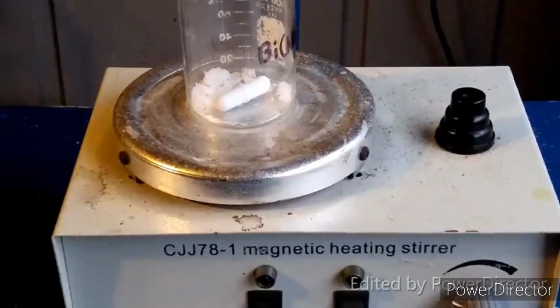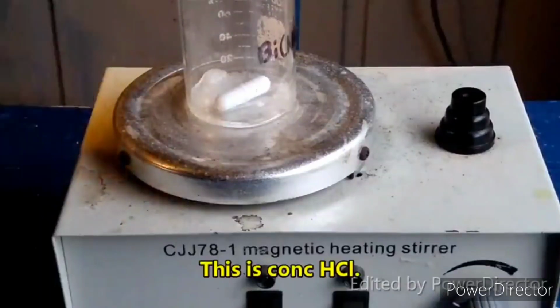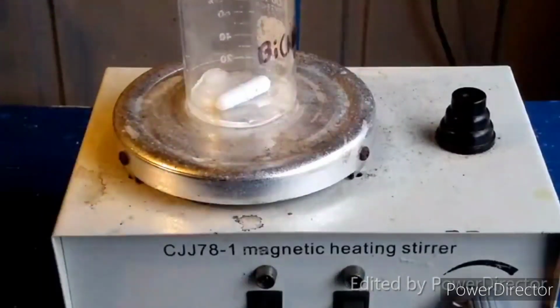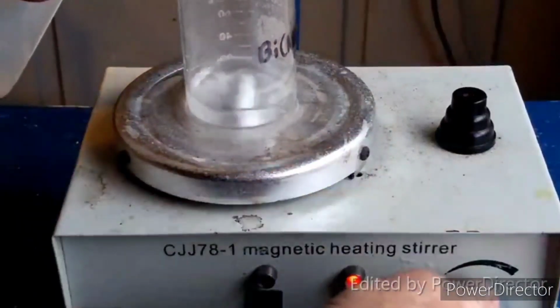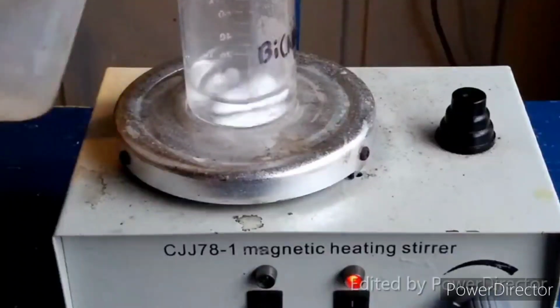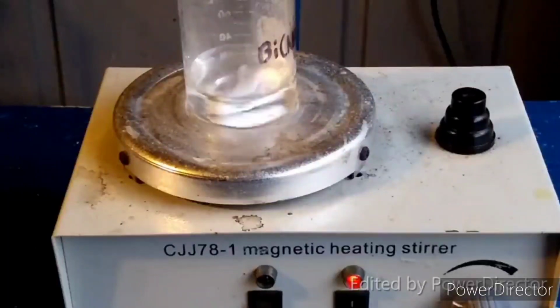Just going to use a little bit here. Don't need very much. And we're going to add a little bit of water to that. Okay, we're going to let that all dissolve.